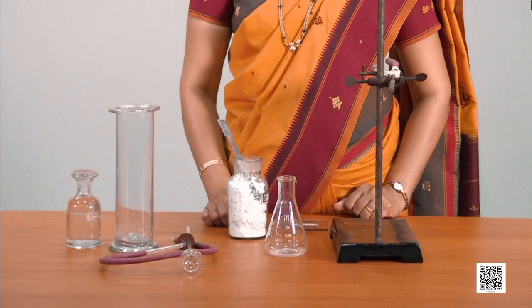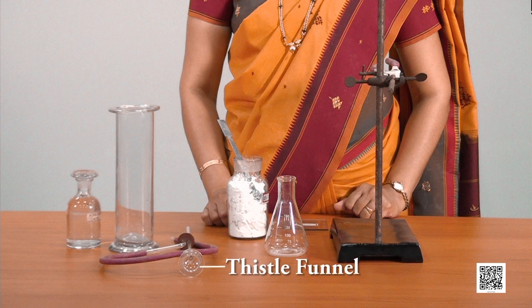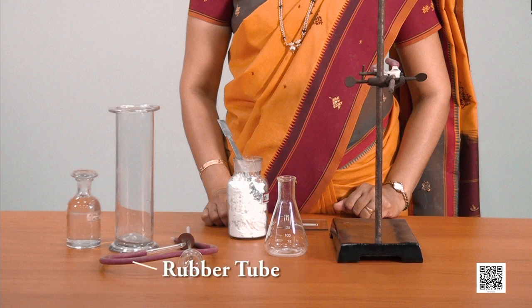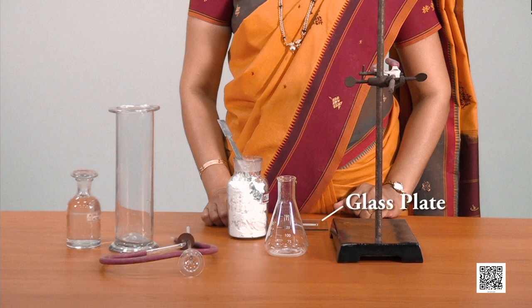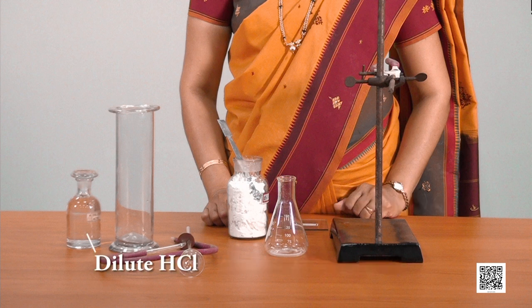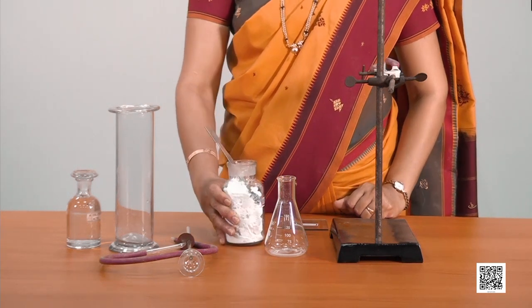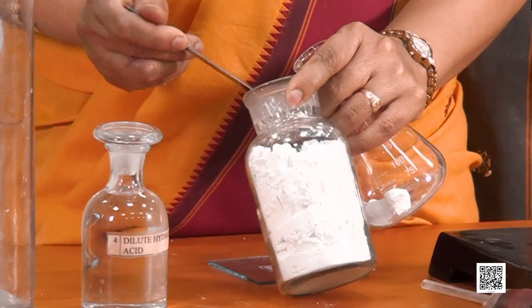Let us prepare carbon dioxide and test its combustibility. To prepare carbon dioxide, we need the following materials: a small conical flask, a 2-hole cork, a thistle funnel, a rubber tube, a glass jar, a glass plate, calcium carbonate, and dilute hydrochloric acid. Take 2-3 grams of calcium carbonate in a small conical flask.